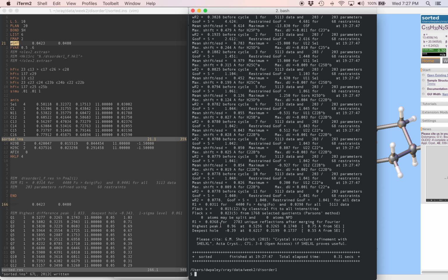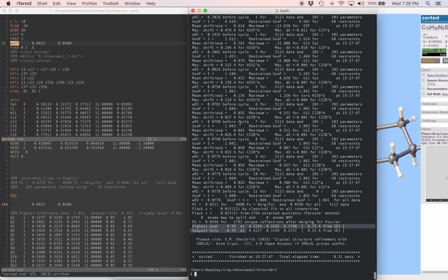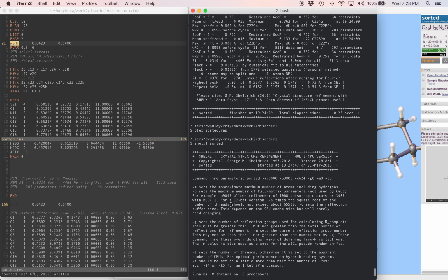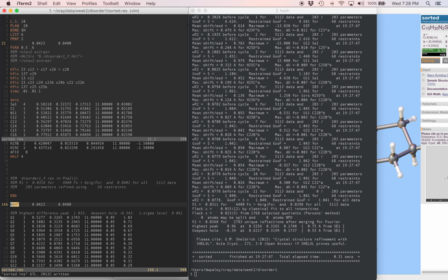When we do that, there's a couple things we can notice. One, the difference map actually got a little bit flatter when I did that. It's common that you'll see the difference between the highest peak and the deepest hole, the pluses and minuses on the map, will equalize a bit when you make the weights more appropriate. I don't know why that happens, but it's a nice thing to look out for. Sometimes you can be pretty concerned about the difference map that you're seeing, and once you get a more appropriate weighting scheme, you'll see that it looks better than it did before. It takes a few rounds before the weighting scheme is going to converge. So I'm going to come over here and reload my res file, repaste into my ins file, and repeat the refinement. And then repeat this job a couple more times.